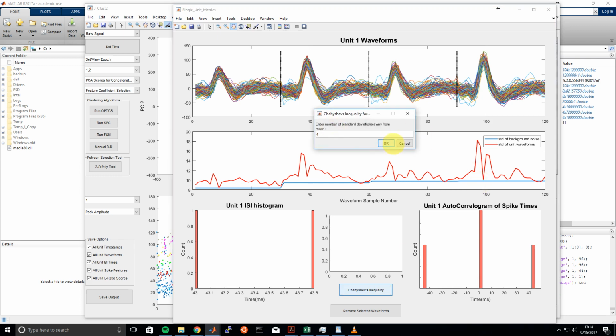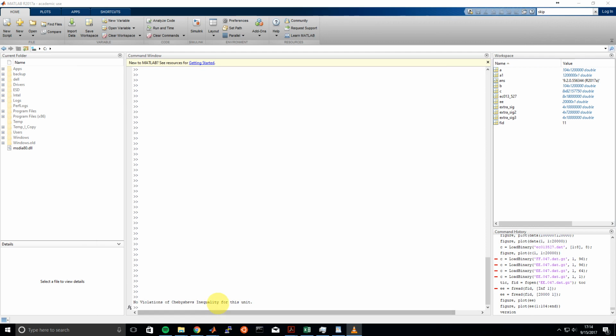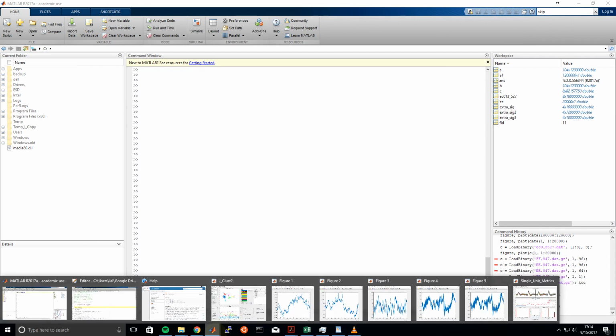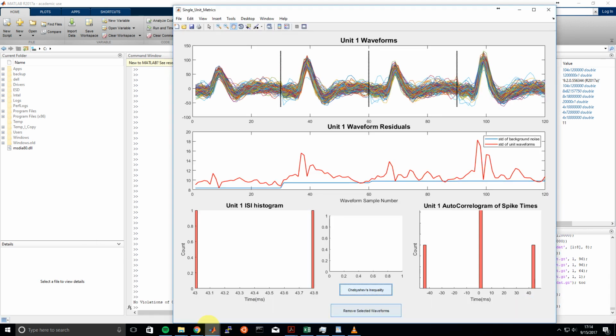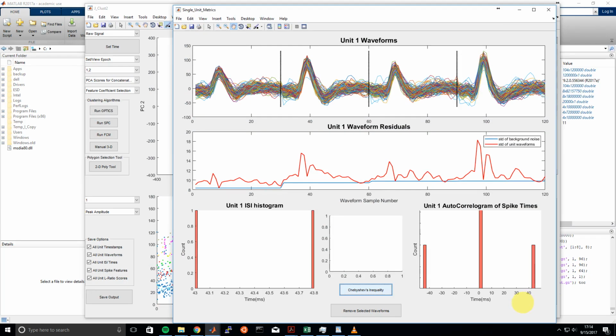And then finally, maybe we'll check Chebyshev's inequality. Maybe we'll look at something that's 4 standard deviations away from the mean. And if we don't see anything pop up on our screen there, then we can go to the command window, and we'll see that we get the display message here that there are no violations of the inequality for this unit. So all in all, this is a well-defined unit.